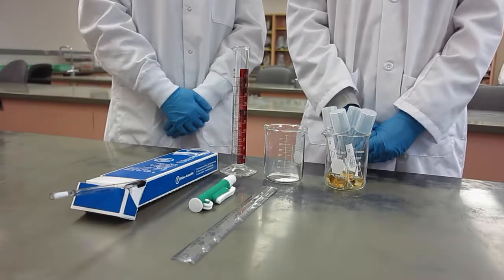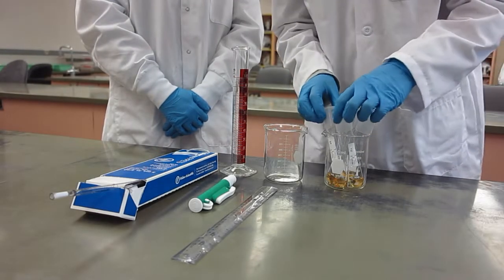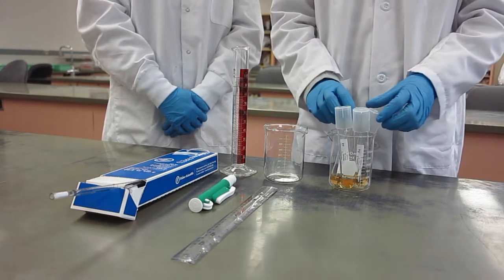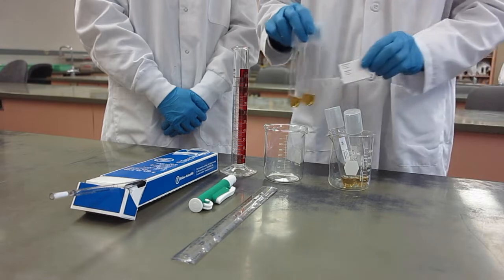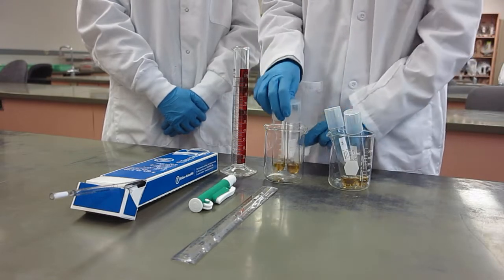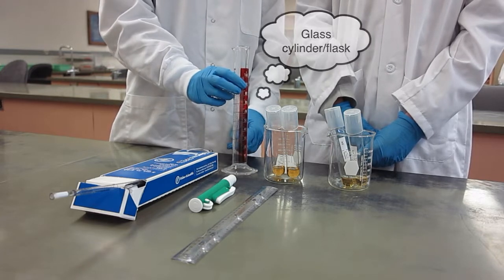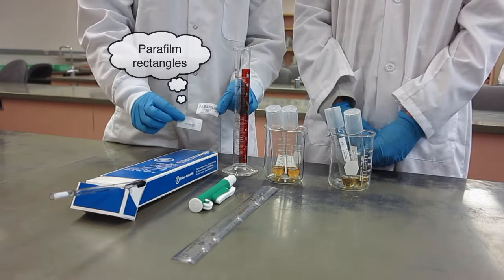In your group's desk, you should have 2 culture tubes with yeast growing in them, labeled appropriately. You should also have 2 new unlabeled culture tubes with no yeast. Label these appropriately. You should have several supplies at your desk. See the lab manual for details.